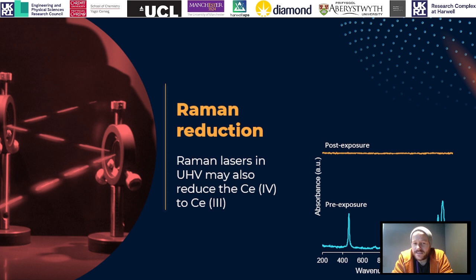It's also quite common nowadays, or relatively common nowadays, to include Raman, so coincident Raman, in XPS. And what we've recently observed is that in UHV, even the Raman lasers themselves can reduce the cerium 4+ to cerium 3+ as well. So these are some Raman spectra from just a commercial ceria on our Thermo Nexsa. We can see the initial scan on the bottom in blue, where we've taken a Raman spectrum of this ceria, and we've got the characteristic peaks. After 15 minutes, this cerium 4+ signal from the Raman laser is completely destroyed, because we've just reduced all of that cerium 4+ down to 3+.